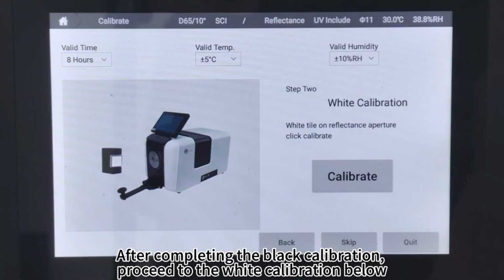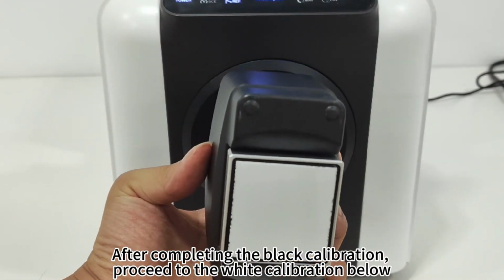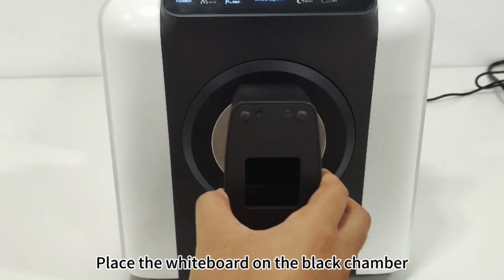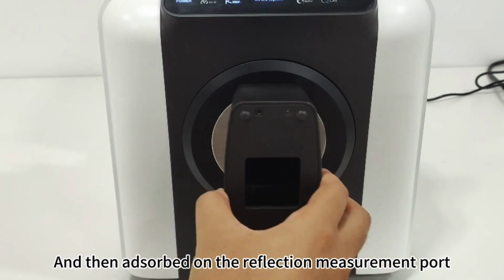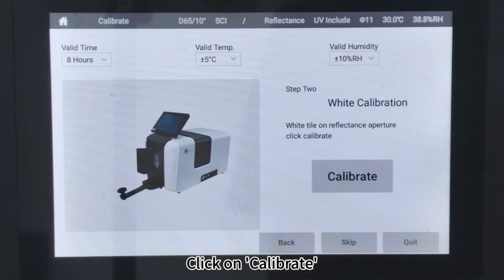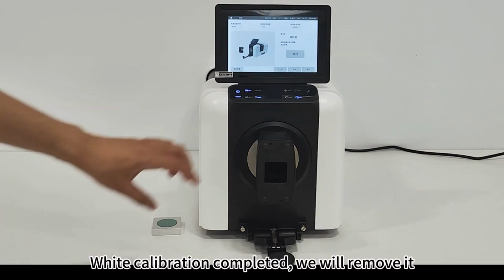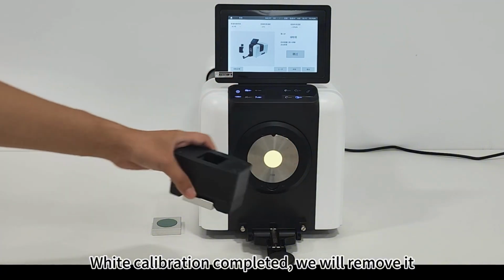After completing the black calibration, proceed to the white calibration below. Place the whiteboard on the black chamber, and then adsorb it on the reflection measurement port. Click on Calibrate. White calibration completed. We will remove it.